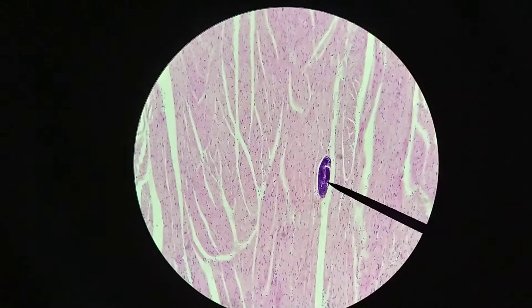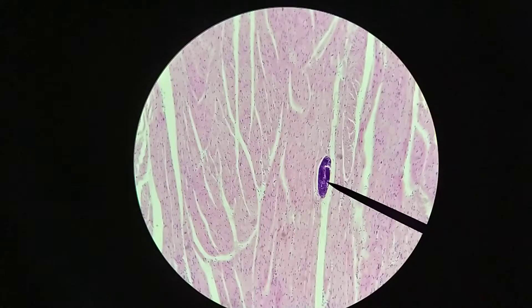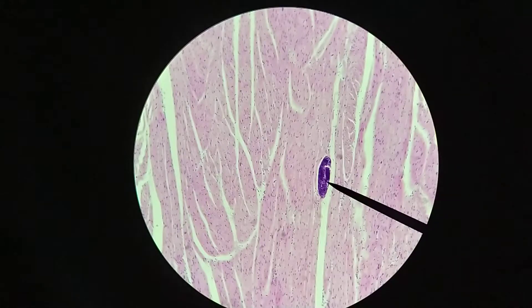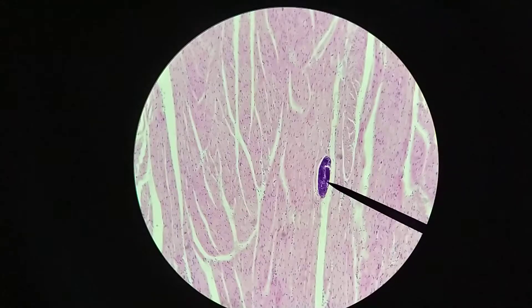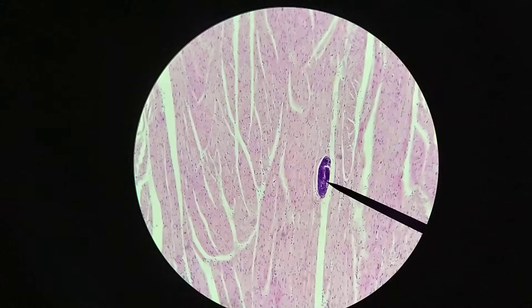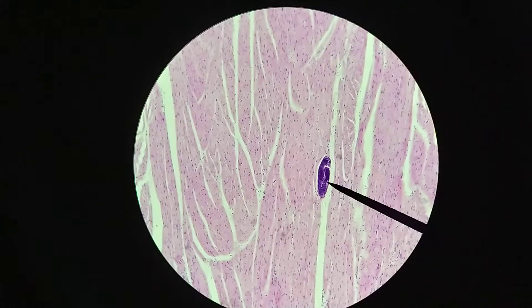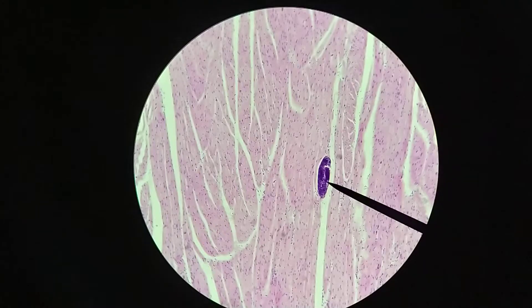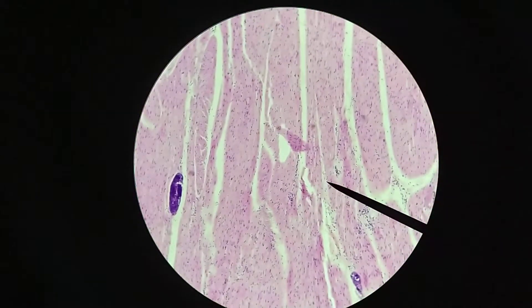You might say this doesn't seem to belong — and it's true, it doesn't. It should not be here, but it is. I actually had to look this one up. These basophilic structures are actually evidence of a parasitic infection. This slide is taken from beef heart, and a very common infection is a parasitic infection by an organism called Sarcocystis cruzi, which tends to affect cardiac muscle and skeletal muscle. These are very basophilic with lots of nuclei — essentially a parasite.